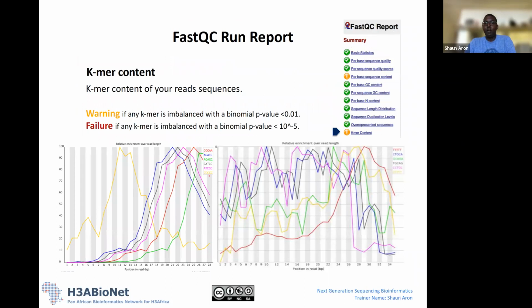Okay, and then the last metric is something called k-mer content. So essentially, this is a metric that looks across the positions in your read. Again, you have percentage on the y-axis, and position on the x-axis. At each position, it looks for overrepresentation of particular k-mers. K-mers are based on what it observes in your data. So it looks for overrepresentation of particular short sequences in your data set.